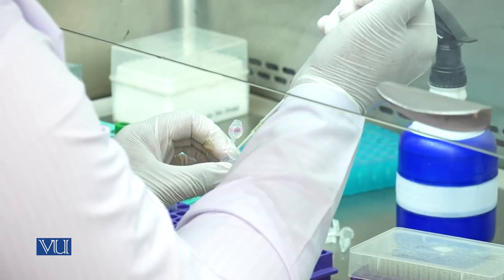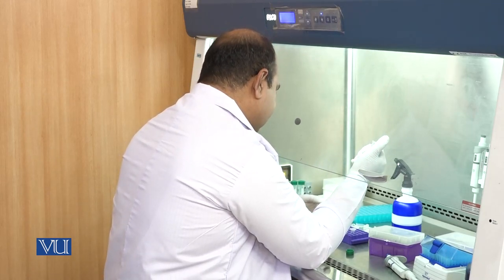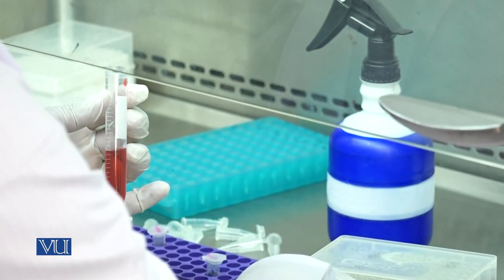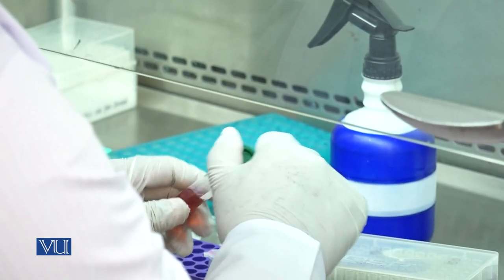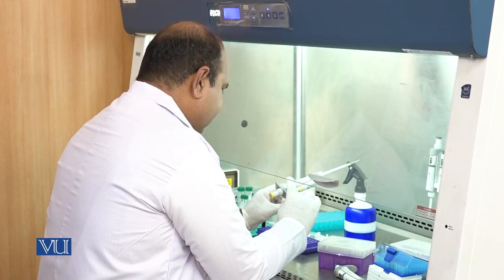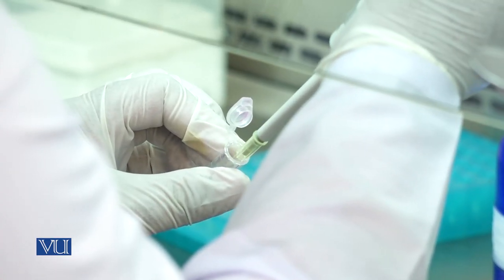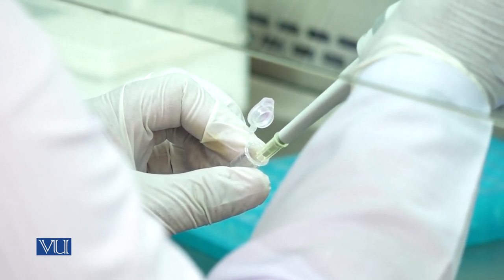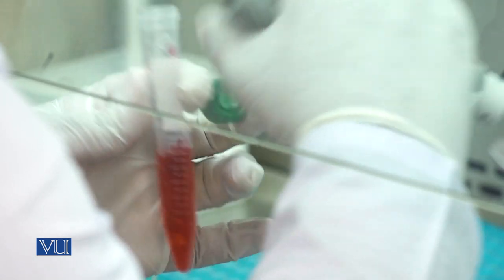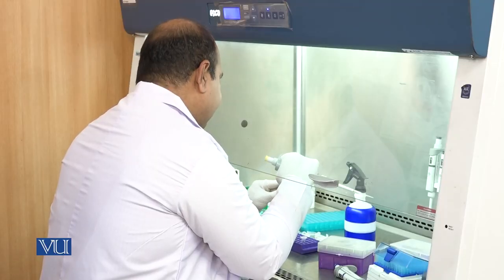Now I am going to add 100 microliters of fetal calf serum, or FCS. Fetal calf serum contains growth factors which are very helpful for the overall growth of the cells, because we want these cells to divide in a healthy form. Next, I am going to add 100 microliters of an antibiotic — gentamicin. You can also use streptomycin or penicillin. The antibiotic prevents the cells from getting contaminated, which is a very important part of any cell culture practical.